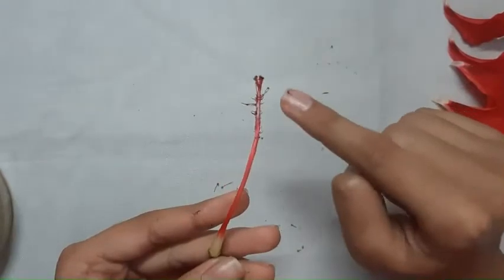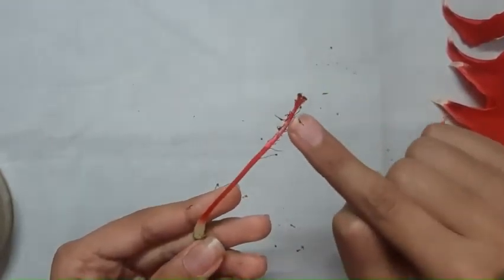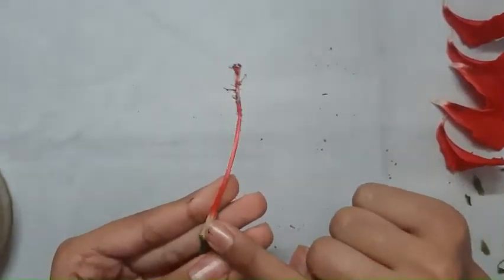After removing all the stamen, the female part of the pistil is revealed. So this is the stigma, style and ovary.